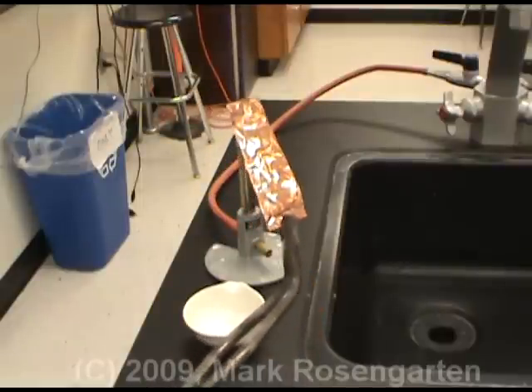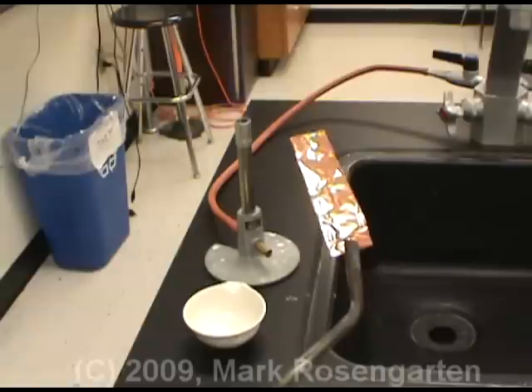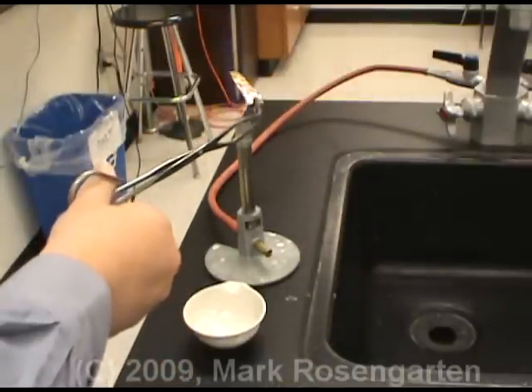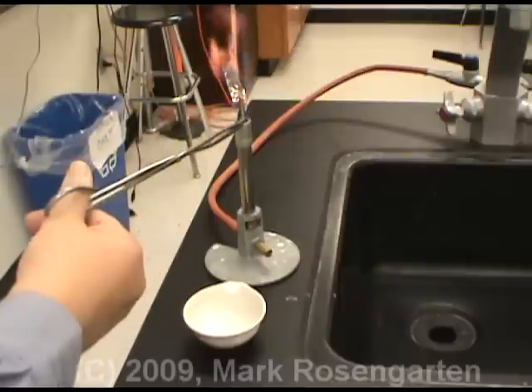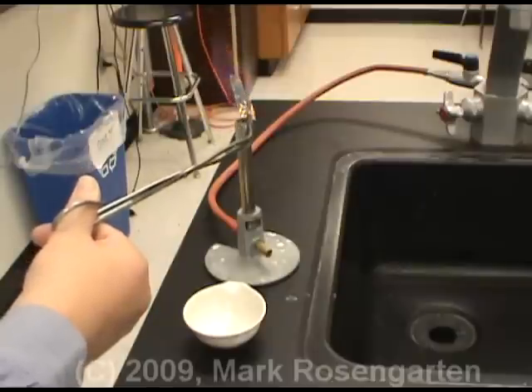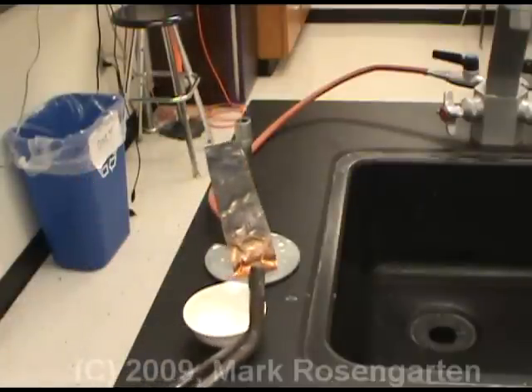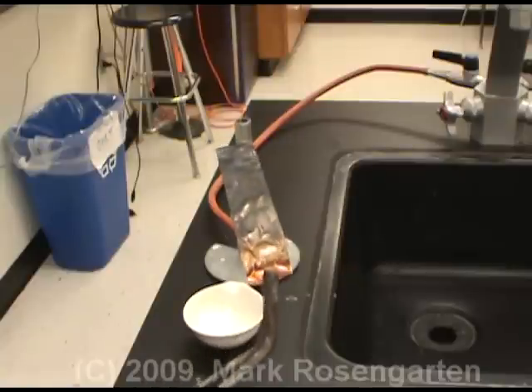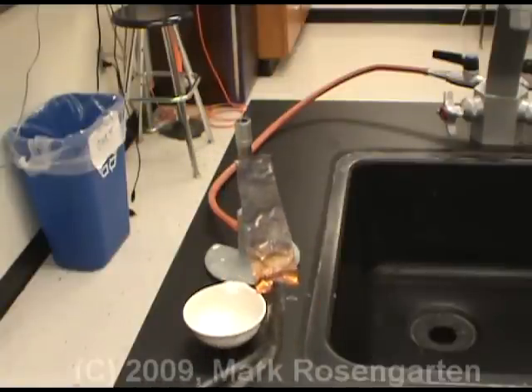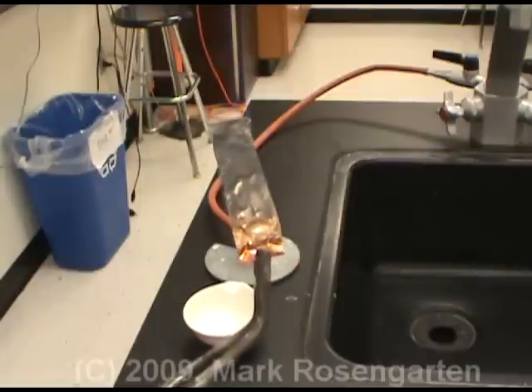Here we have the much less active metal, copper. When copper undergoes a similar kind of change — heating it up in a Bunsen burner flame — you notice it doesn't catch fire, but instead darkens. The darkened area is copper oxide. Again, a synthesis reaction by reacting copper with oxygen in the air.